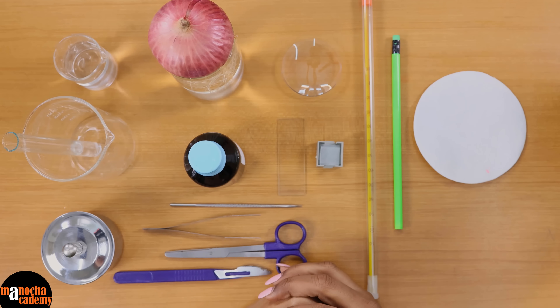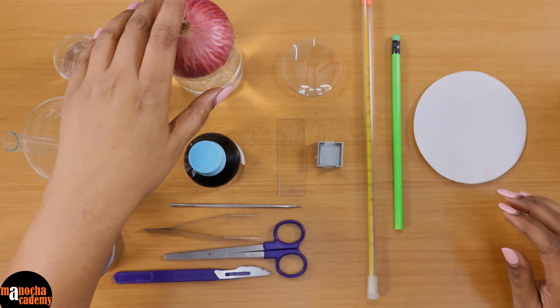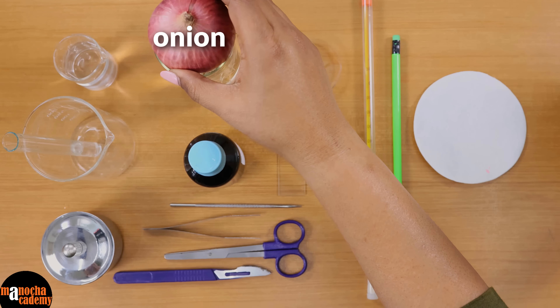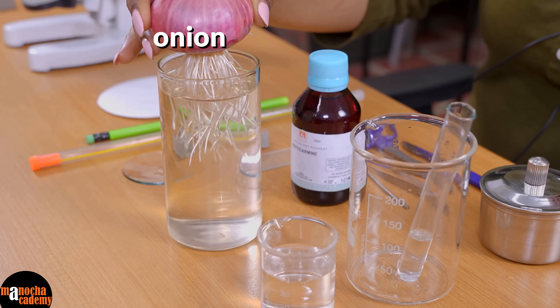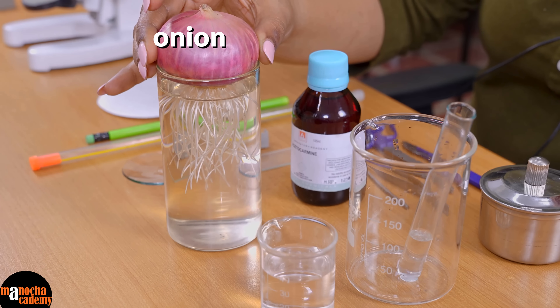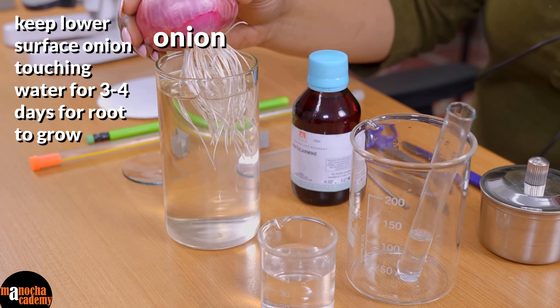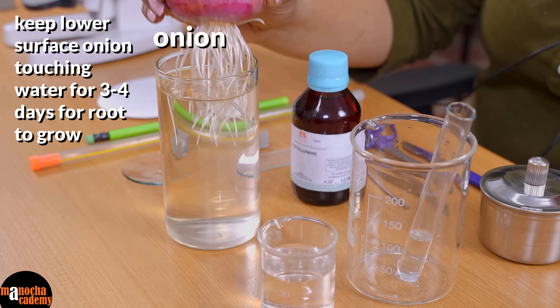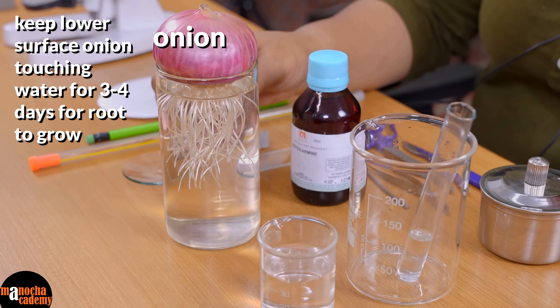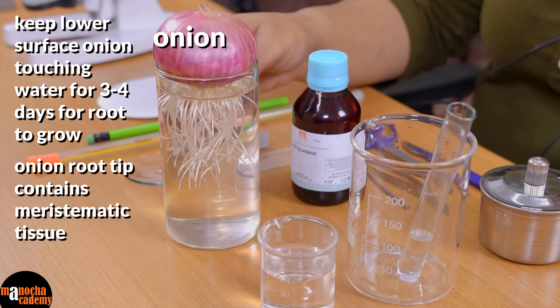Let's start with the apparatus that we need. Of course we will be needing an onion. This onion has been kept like this for about three to four days. If you just take an onion and keep its lower surface in contact with water, you will see roots coming out of it. We will need these root tips because these root tips contain meristematic tissue.